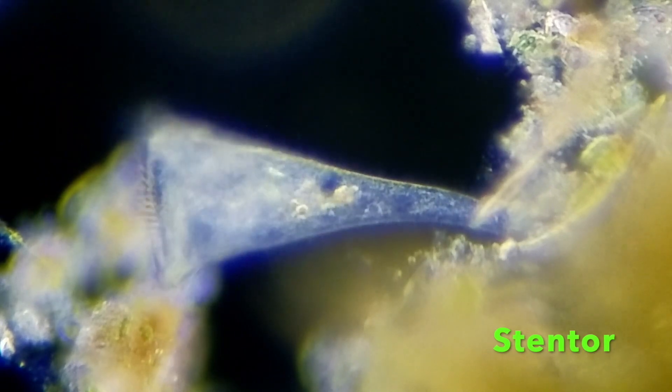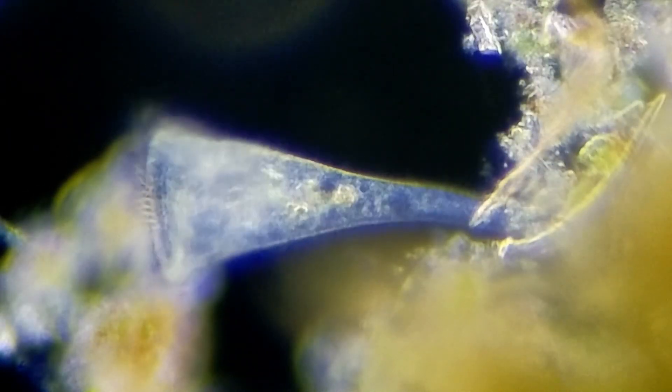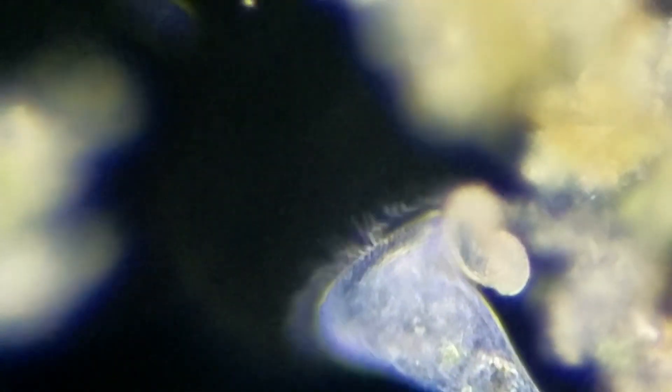Now here's one of my favorite microorganisms — the stentor. There are different species of the stentor, but they look like a trumpet, which makes them very easy to distinguish from many other types of microorganisms. They have cilia hairs at the end that spin around creating a vortex and suck things in. You can see little particles being sucked in as it spirals the water like water going down the drain. And those cilia hairs also help them to swim.